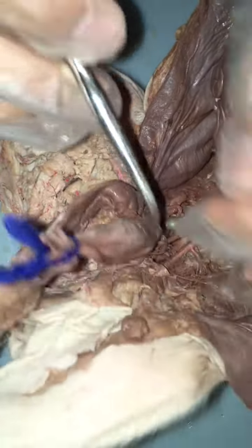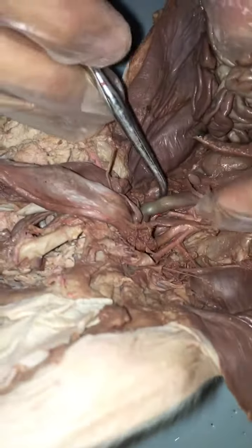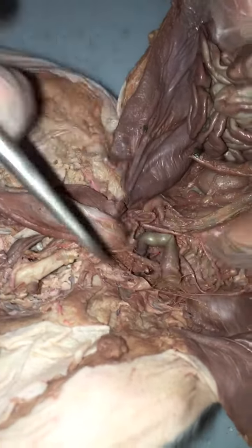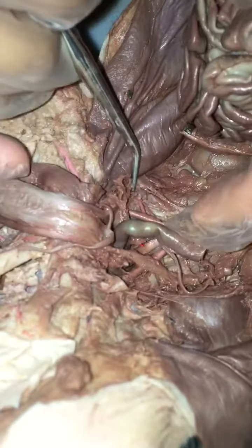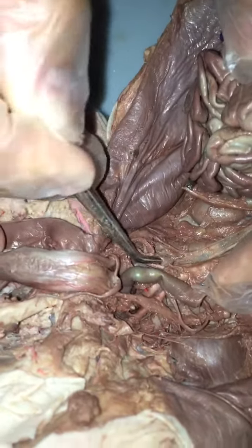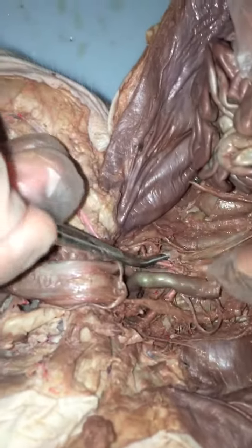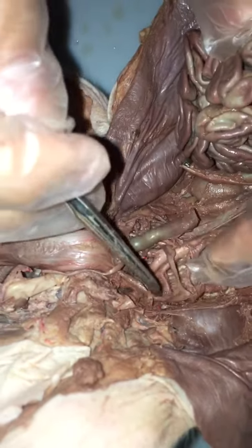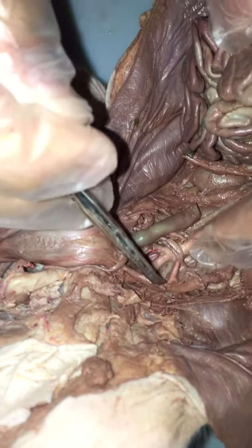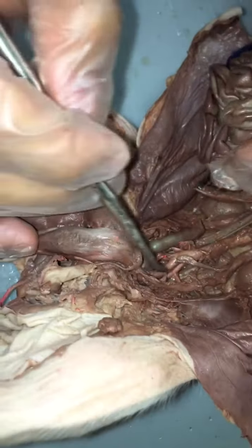And the common iliac vein. Common iliac vein is usually right under these arteries, but it looks like it's gone here. Where is it? Oh, right here. Under connective tissue again. This should be the common iliac vein. It's not that blue, you can't really tell. We most likely won't ask it if we can't find it, but it's usually right under it and it's blue. The common iliac vein.